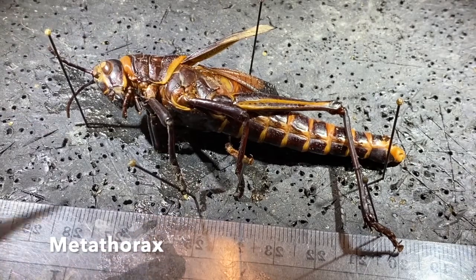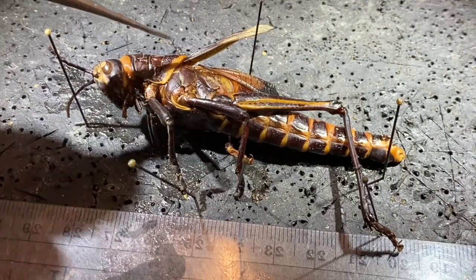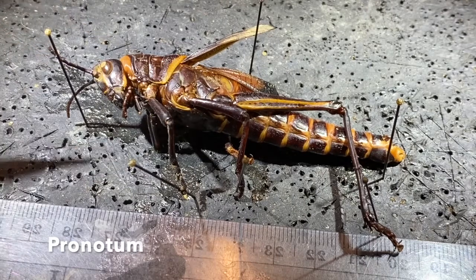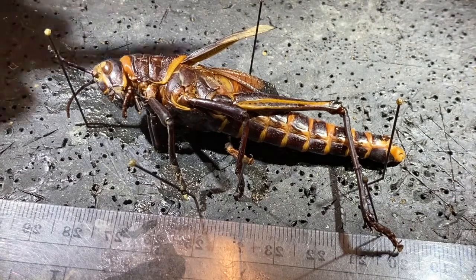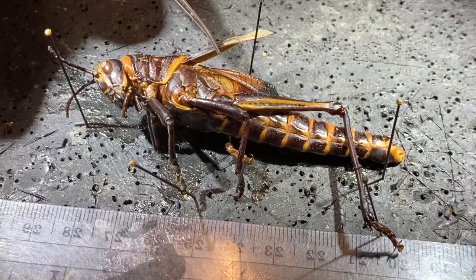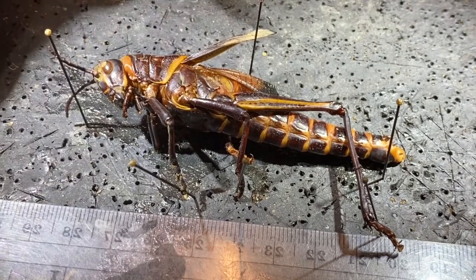The prothorax and part of the mesothorax are covered in grasshoppers by this structure that looks like kind of a saddle-shaped structure. This is the pronotum. The insects also have 2 pairs of wings, a pair of forewings and hind wings. The forewings are attached to the mesothorax, and the hind wing is attached to the metathorax.